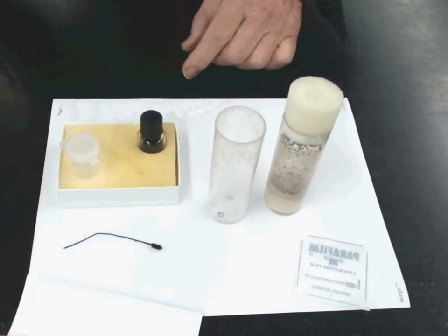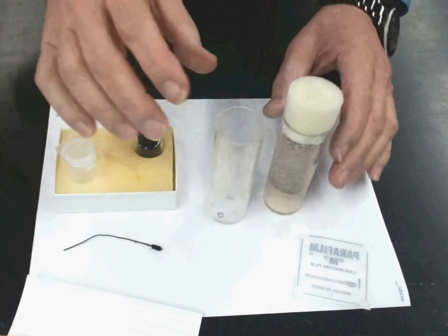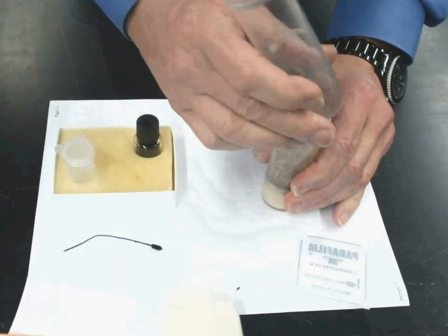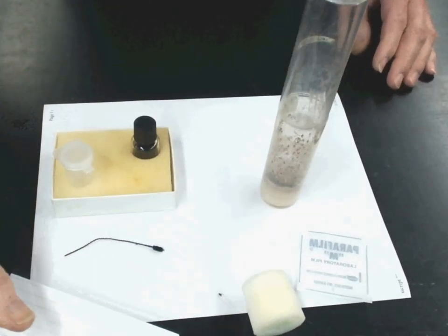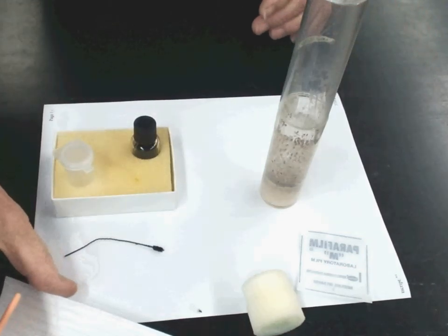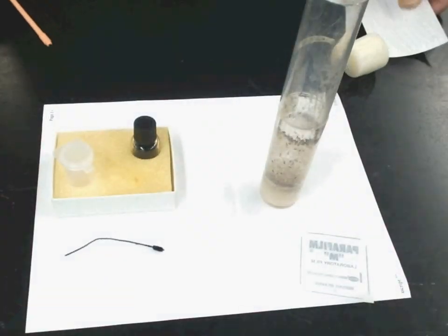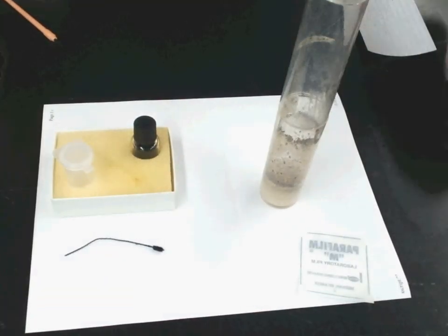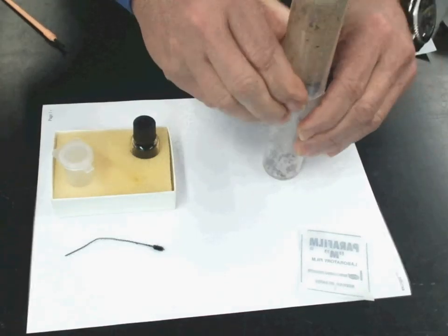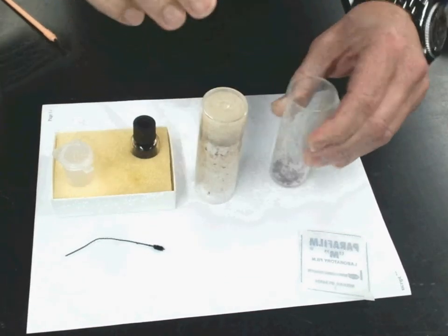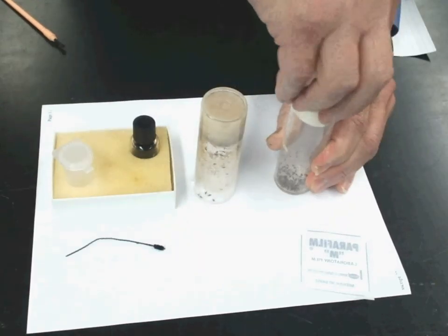The first thing you have to do is a live transfer of the flies. A few ways to do this. One is simply to allow them to crawl up. We have a few escapees. I'm just going to tap down all the adults. Okay.